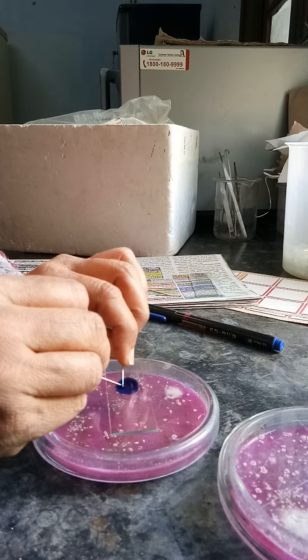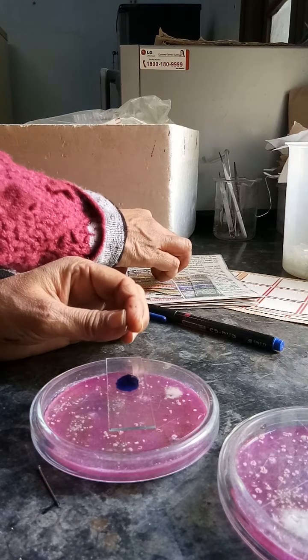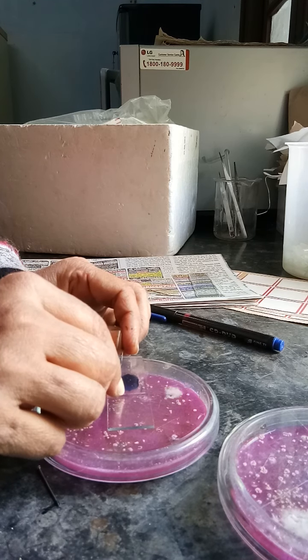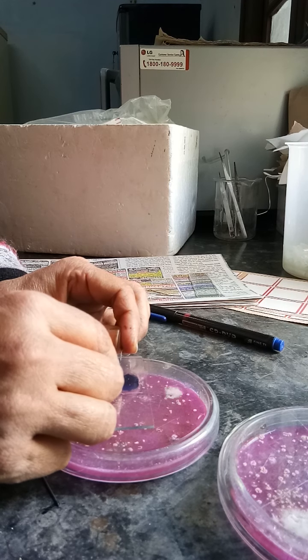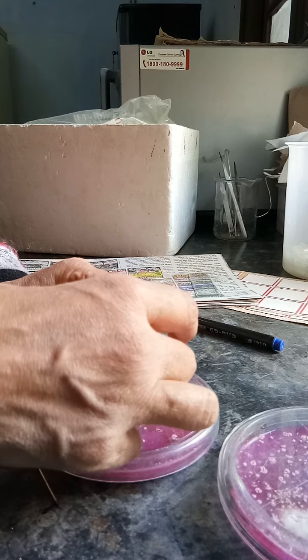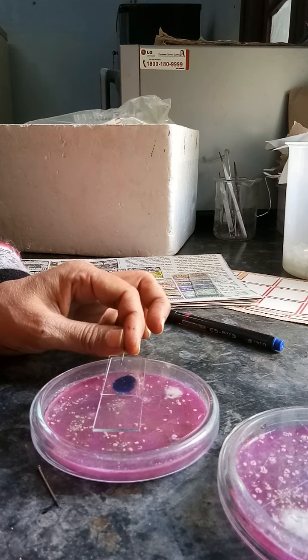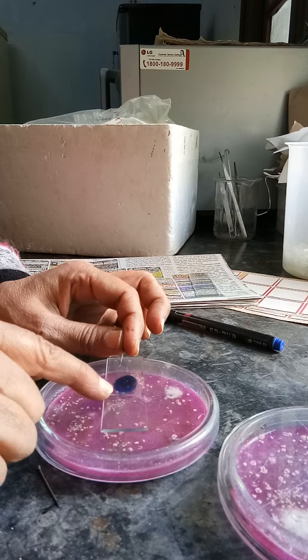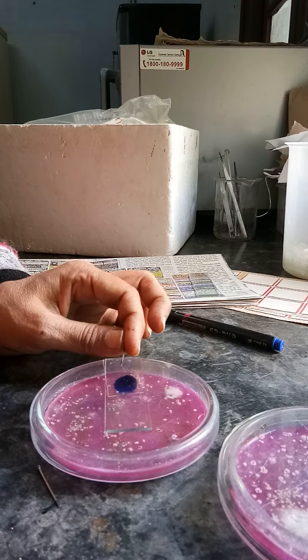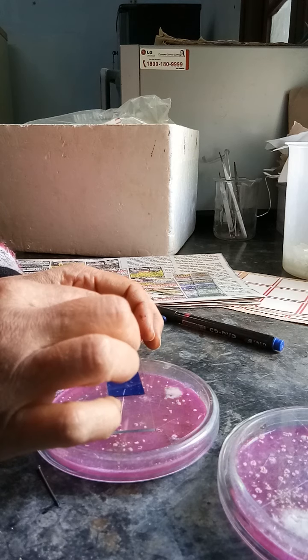Now our separation and disintegration of the mycelial threads is almost done. With the help of one pin I will take the cover slip and hold it at 45 degrees with the help of another pin. I am putting the cover slip with such speed and precaution that there should not be any air bubble inside the drop of lacto phenol solution. I am placing it over the glass slide carefully.